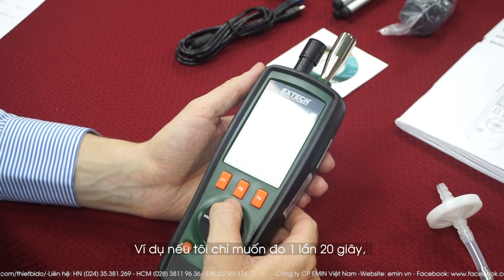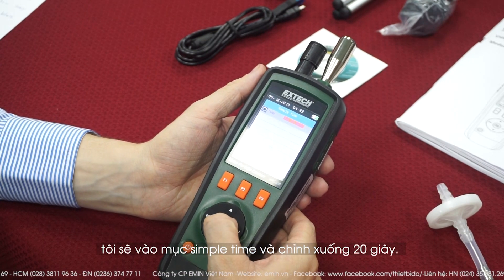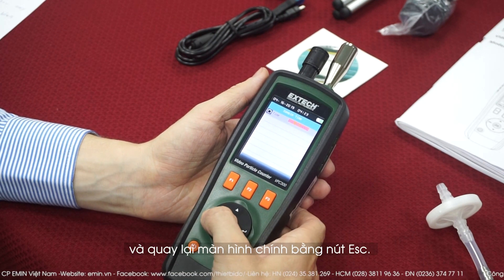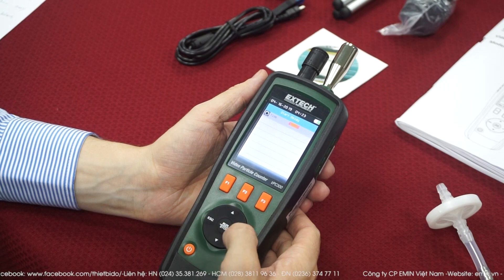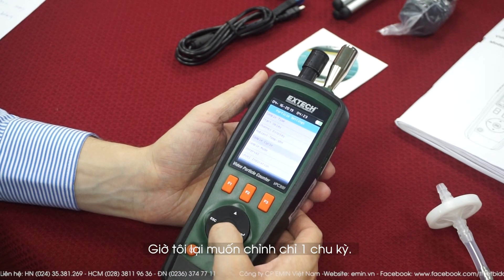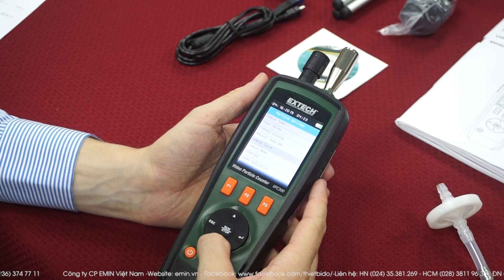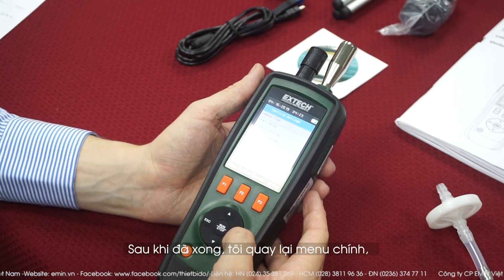Let's say I want to do only one measurement that's going to be 20 seconds long. So I go to sample time and go down to 20 seconds. Once it's done, I validate with the arrow and escape to go back to the menu. If I want the start delay to be 10 seconds, I go here and set it to 10 seconds, then validate and go back. Now let's say I want only one cycle — I go down to one. Validate and go back. And since there is only one sample, there will be no interval needed.